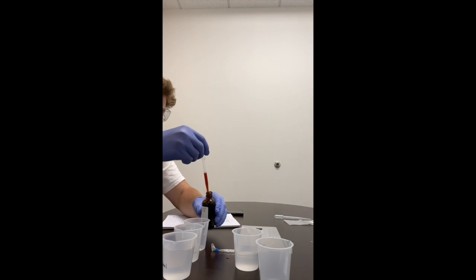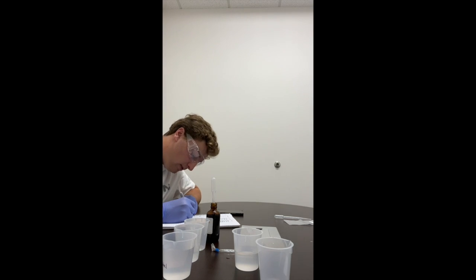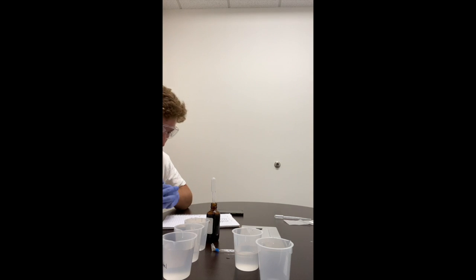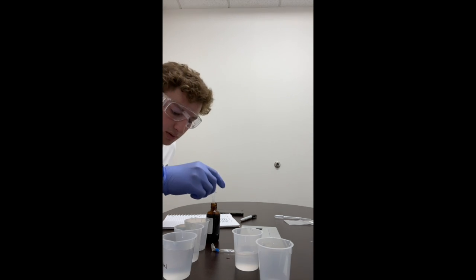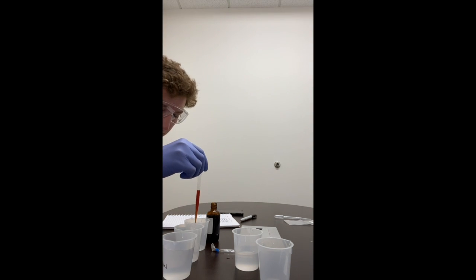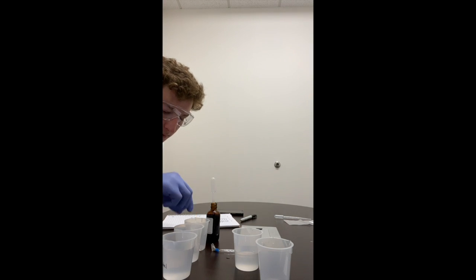Now we'll take the IKI. Put half of it in there.